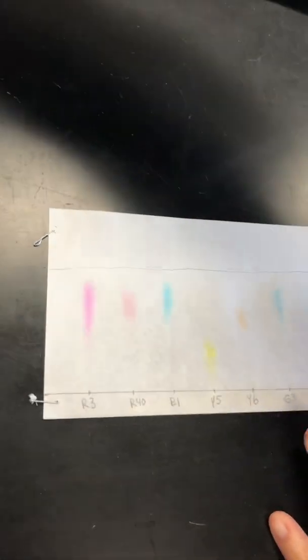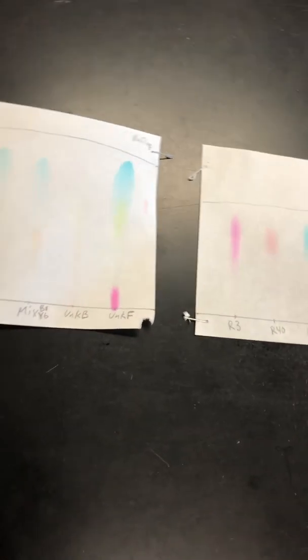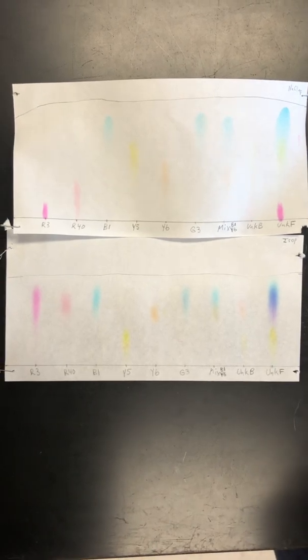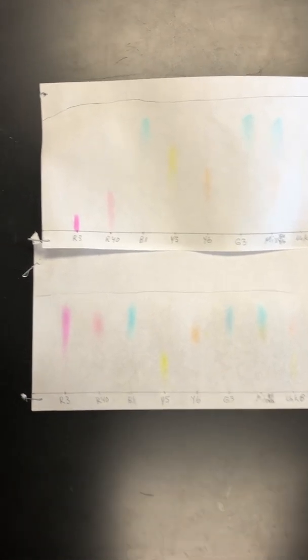So now the last thing I'm going to do is I want to show you both of them side to side. Okay? So you can kind of see, we'll flip the camera a little bit for you. So now you can kind of see the difference, or maybe it might be easier if I put them on top of each other so you get a better comparison. So the salt is on top and the isopropyl alcohol is on the bottom. So you could kind of see which ones separate better, which ones took longer, which ones took slower, all of that.